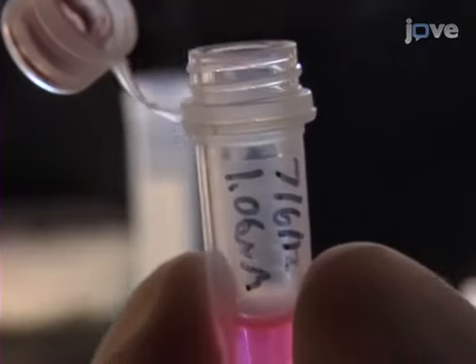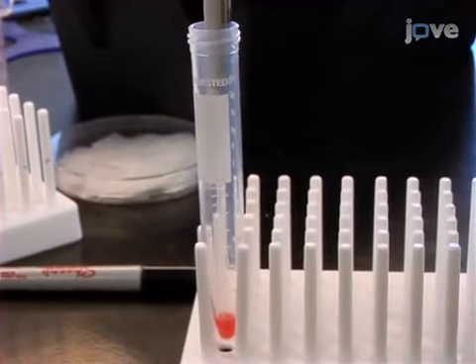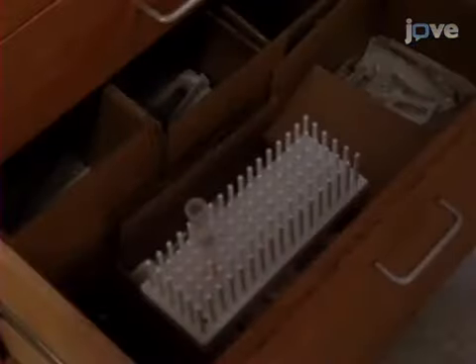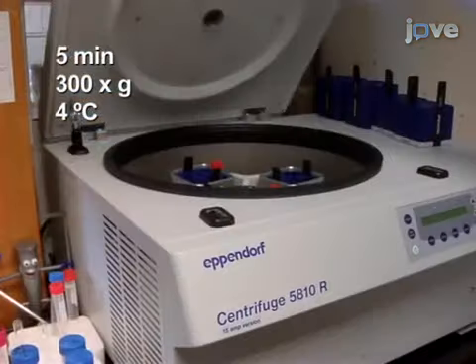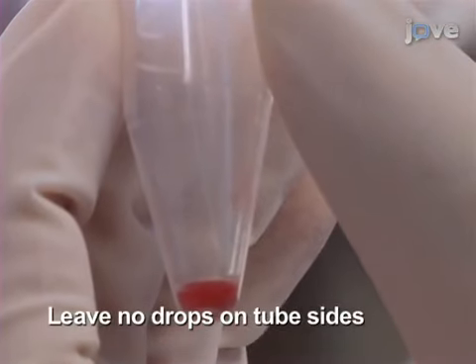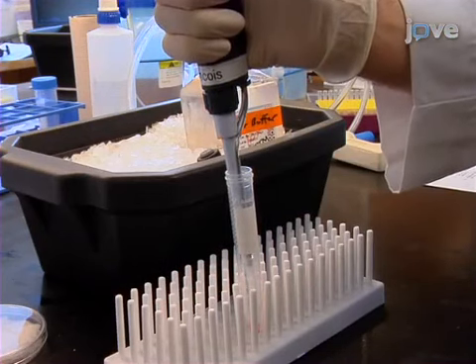To stain for antigen-specific T cells, add fluorescently tagged Peptide MHC Tetramer to the resuspended cell pellet at the optimized concentration. Then, mix the cell suspension and incubate it at the optimized time and temperature for tetramer binding. Next, add cold sorter buffer to bring the volume up to 15 milliliters and centrifuge. Keeping the cells at 4 degrees Celsius from now on, carefully aspirate the supernatant. Then, resuspend the cell pellet in sorter buffer to a final volume of 200 microliters.